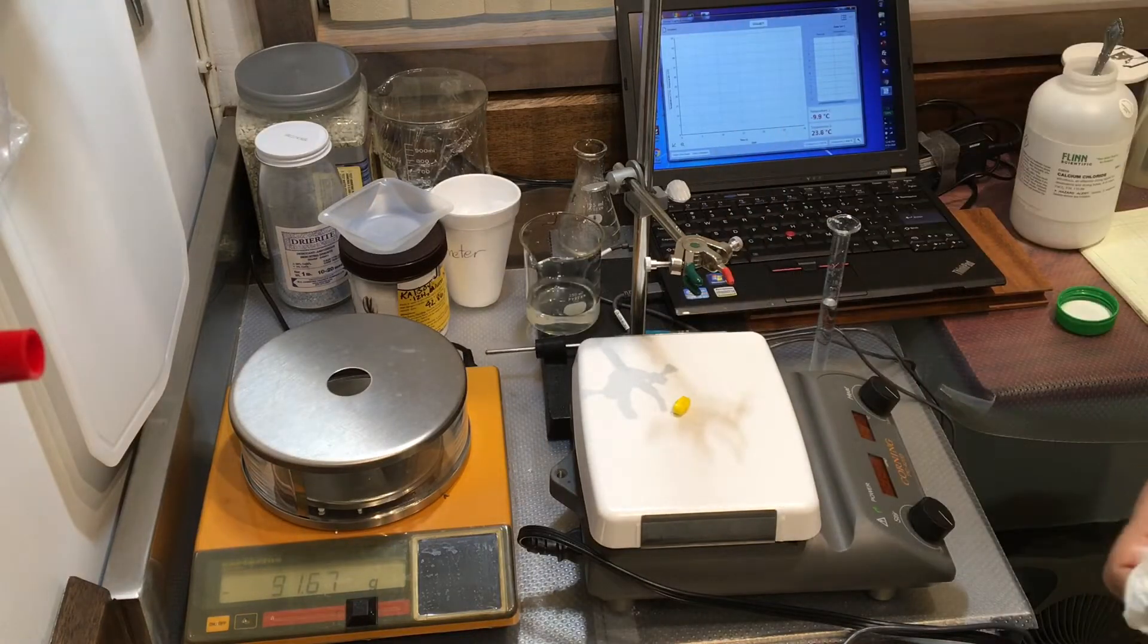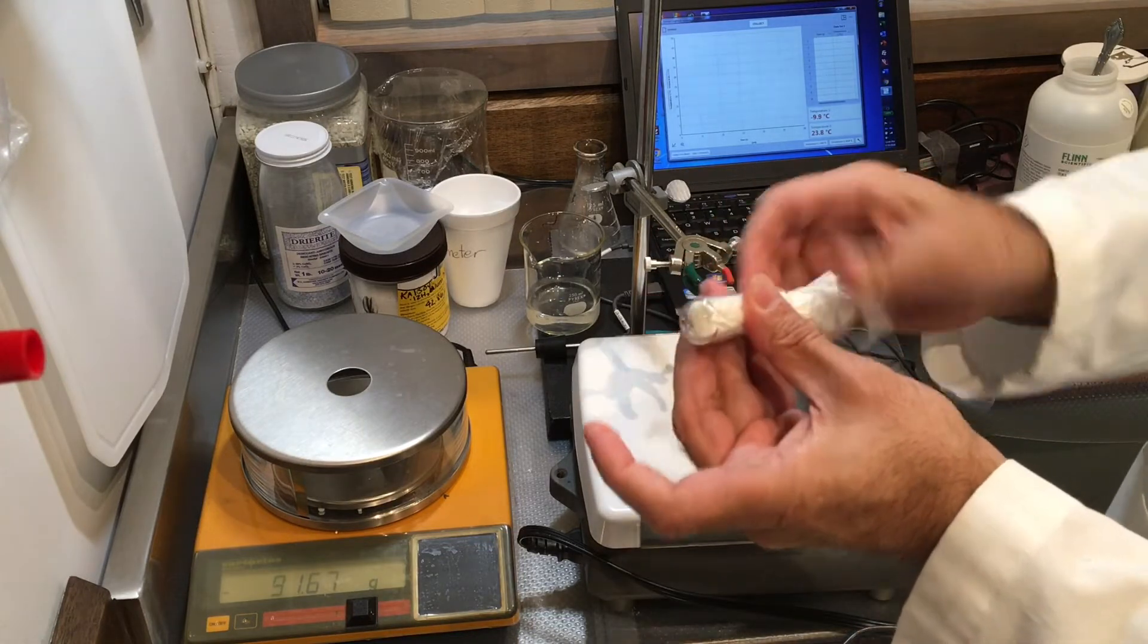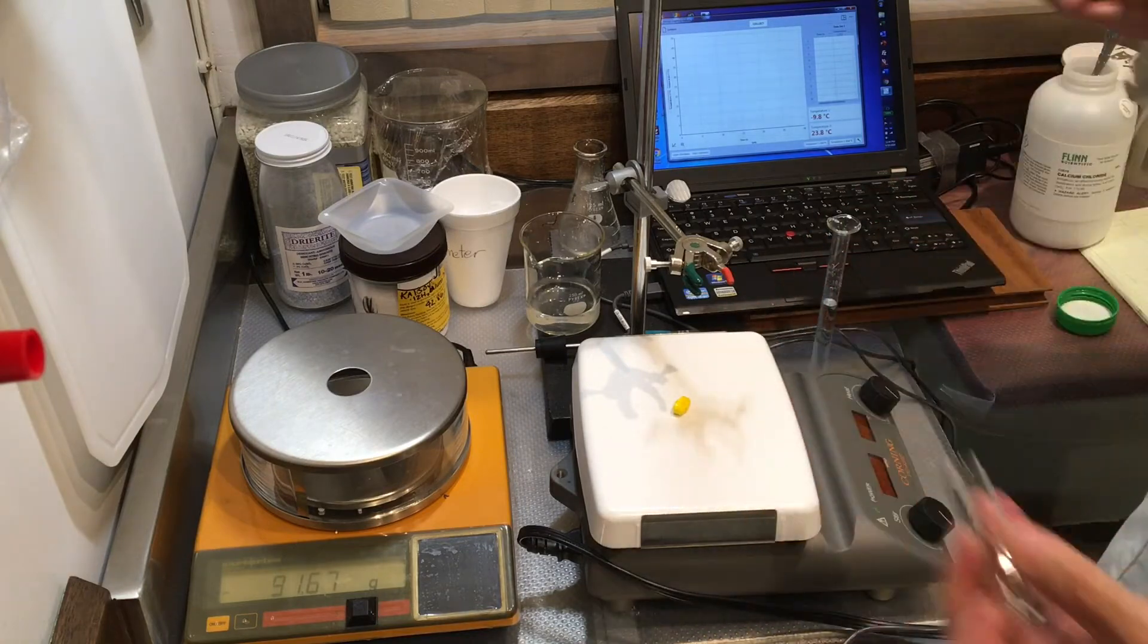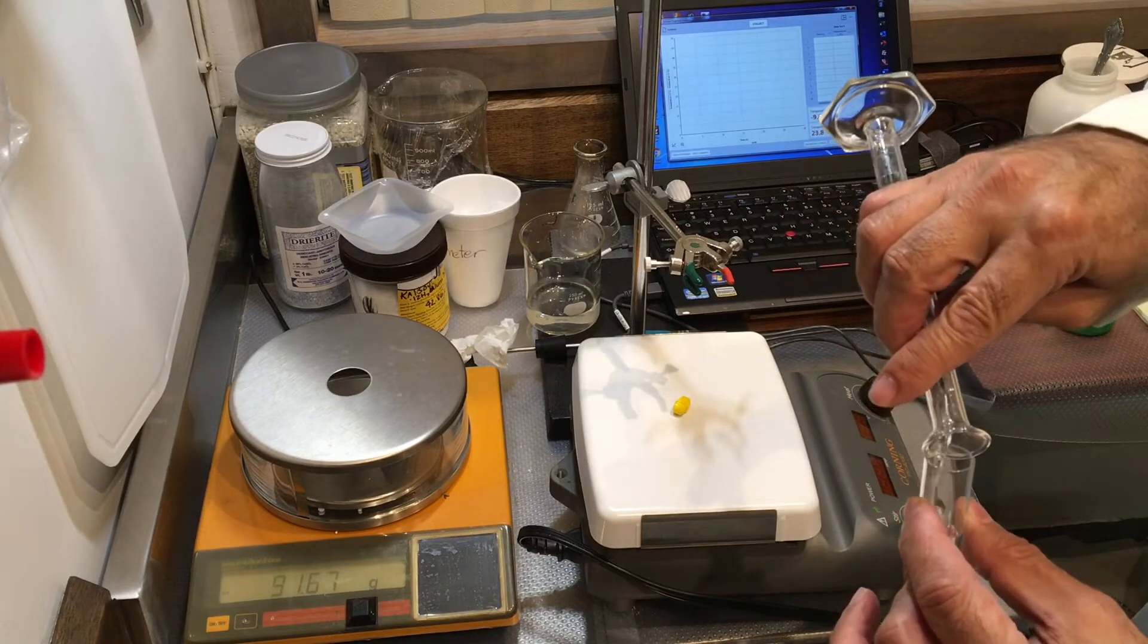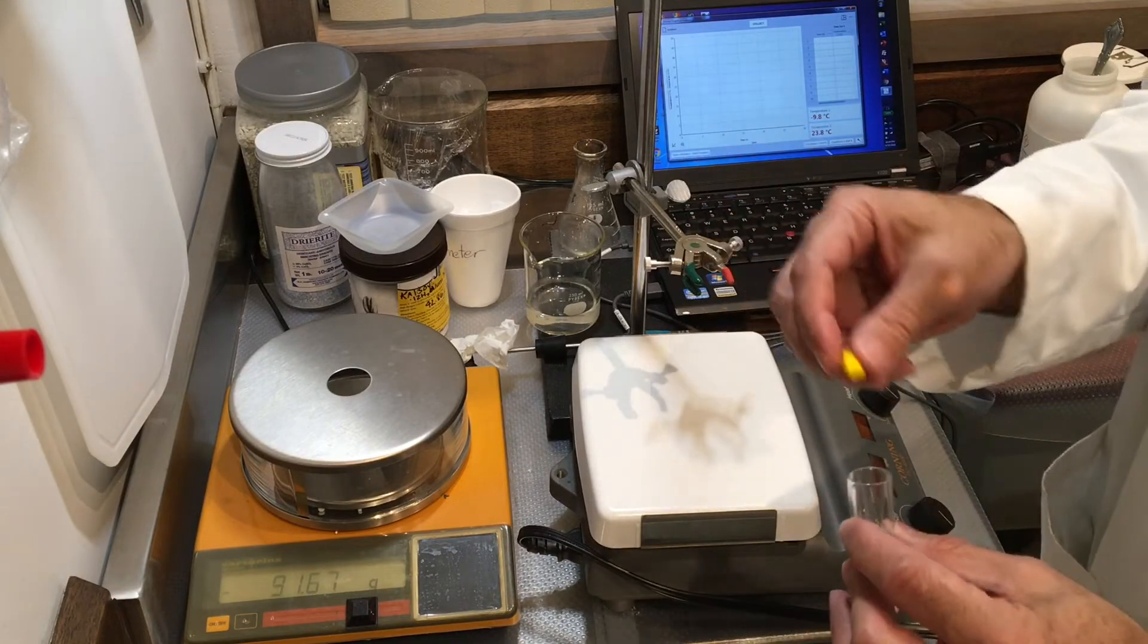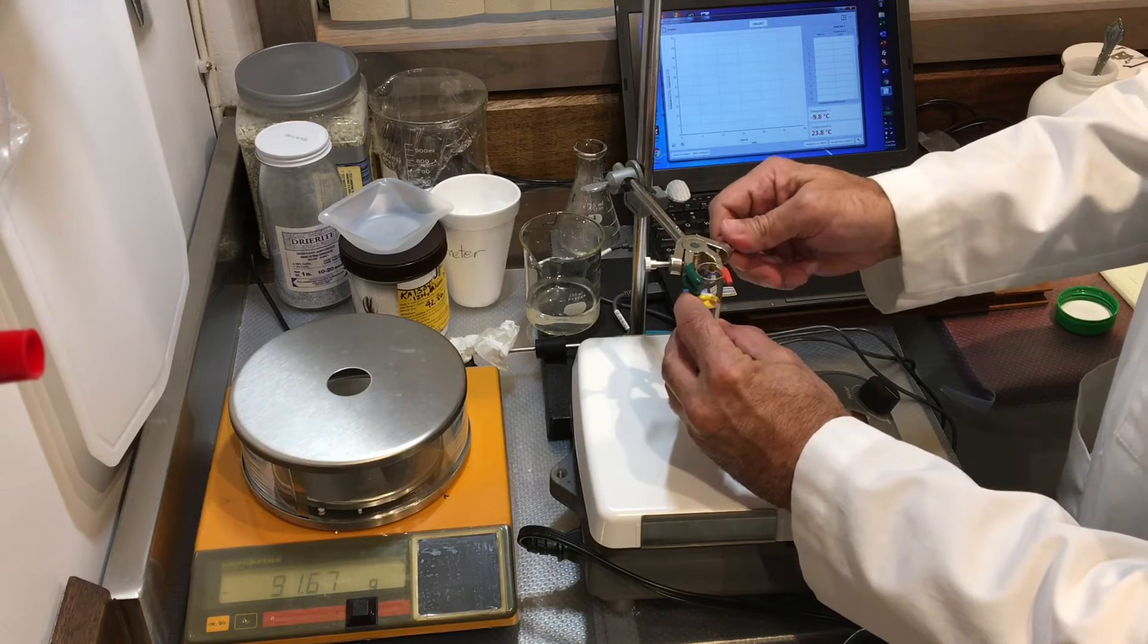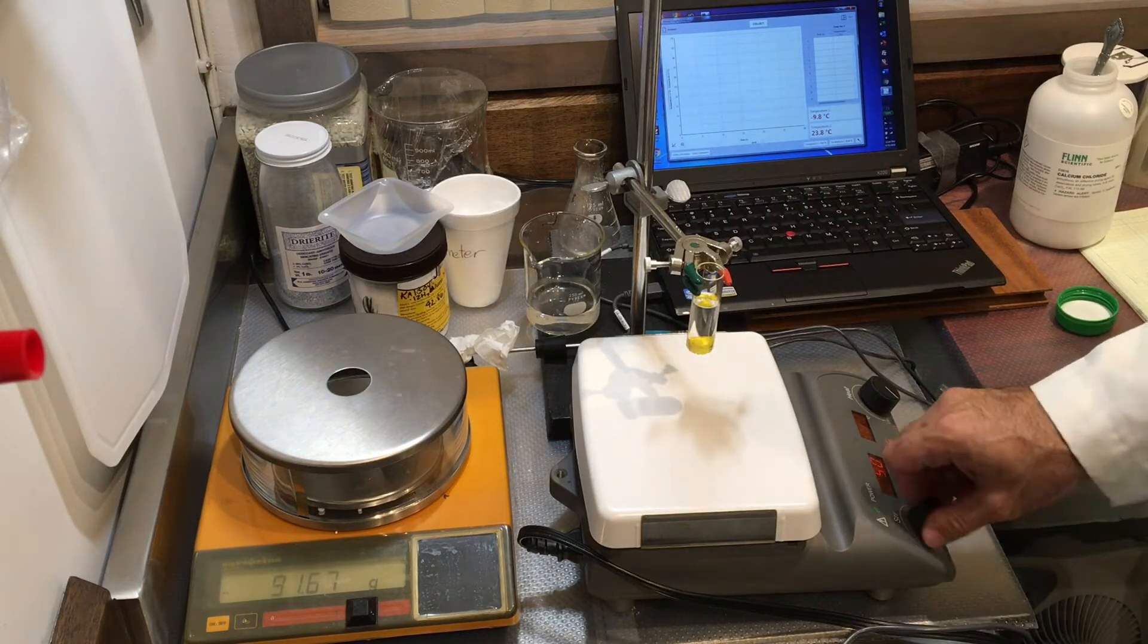This is a lot easier to dry, so I'm just going to stick some paper towel inside and dry this. We are doing this so that we don't change the concentration of the solution, because I've already made my solution. If you have any water here, you will dilute this, and we don't want that. There's my 8 milliliter transferred, and our magnetic stirrer inside, and we're going to mount this the same way as before. The stirrer should work. Perfect.